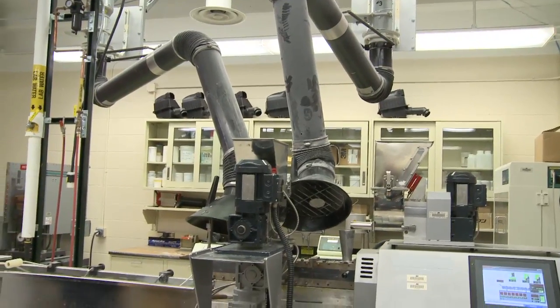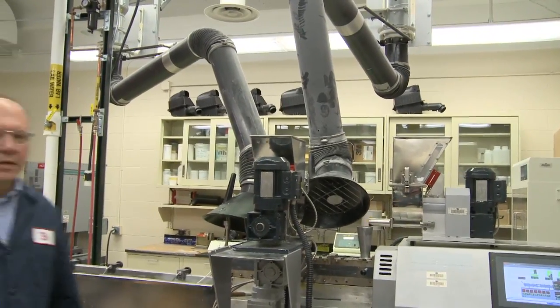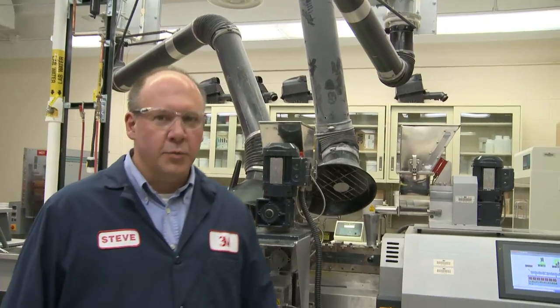This is my glass bubble application laboratory at 3M. This is where we put glass bubbles into plastic, make test specimens, and measure physical properties so we can assure customers that we can provide a glass bubble-filled composite that is low in weight but also matches the specifications in application.